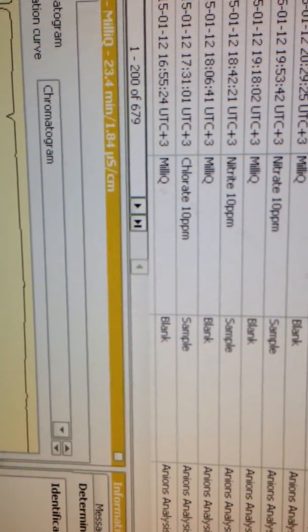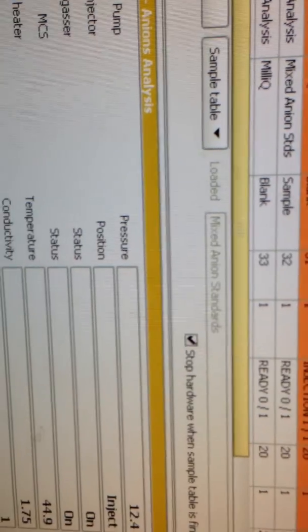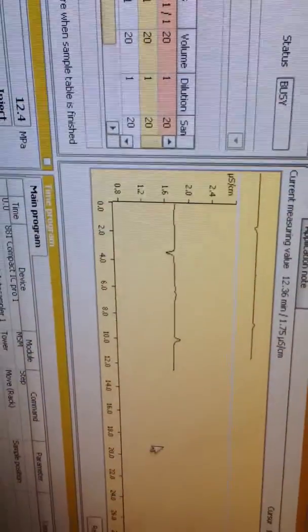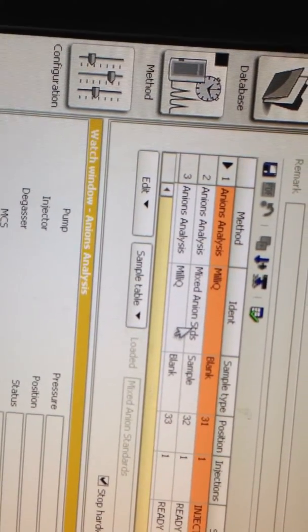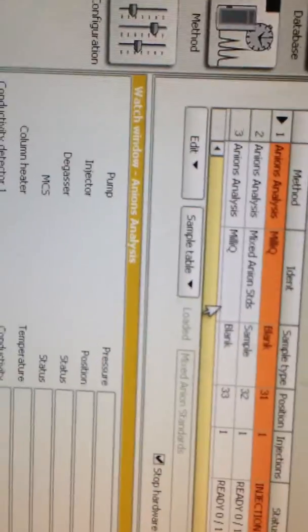Today I am running mixed standards. Okay, let's go here. Today I'm running mixed standards, so we will see what we get with our results. Now it's running the blank for half an hour, then next will be mixed standards. Once I get this as well, I will send the results.